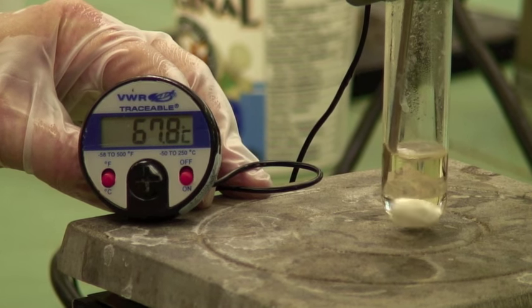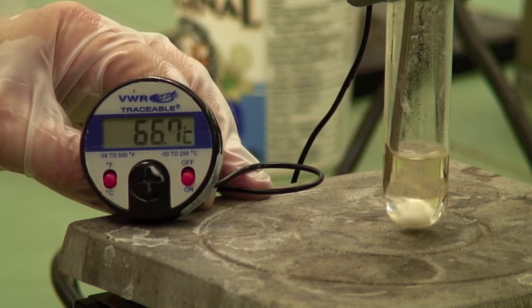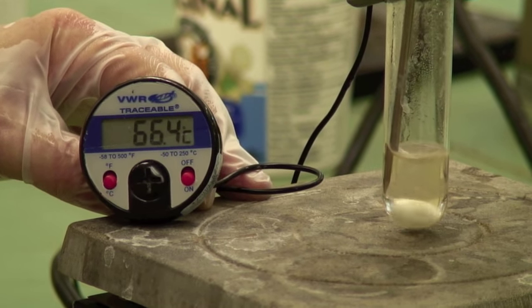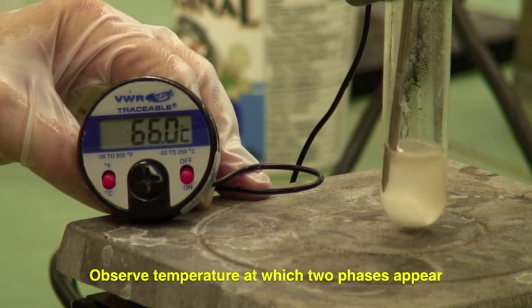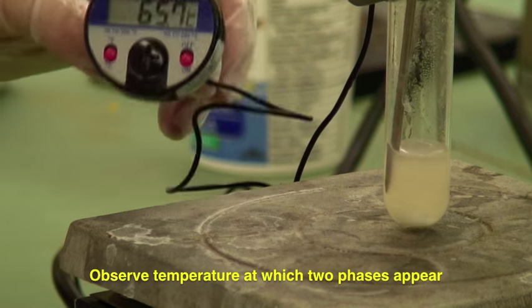And I've done this sample before so I know when it's going to be. It's pretty soon now. And there we go. It's now become opaque at 65.9 degrees.